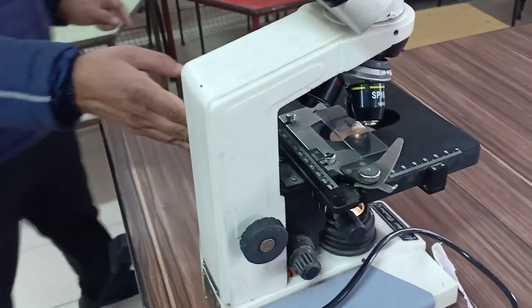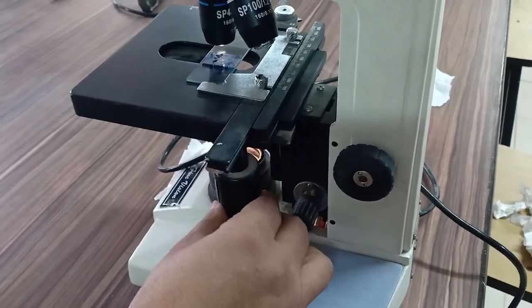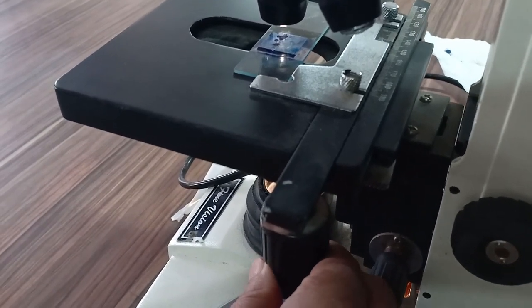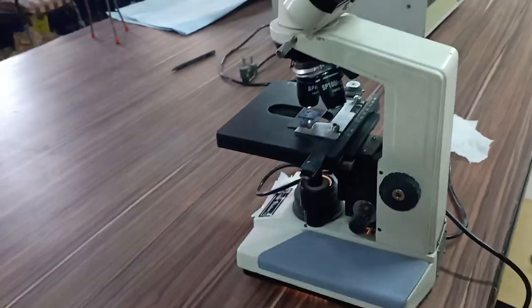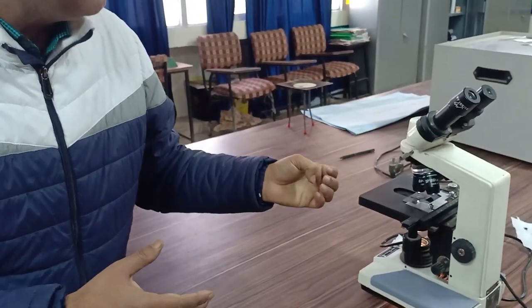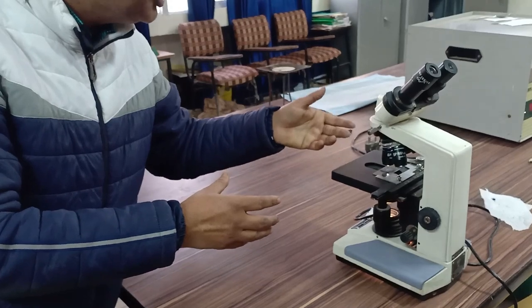Adjust the microscope carefully and observe through the eyepiece whether living or non-living pollen grain cells are present. Count the number of living cells and non-living cells. For example, if the total living and non-living cells of a petunia flower slide is 16, and you observe 8 living cells, you can use these numbers to calculate the percentage viability.